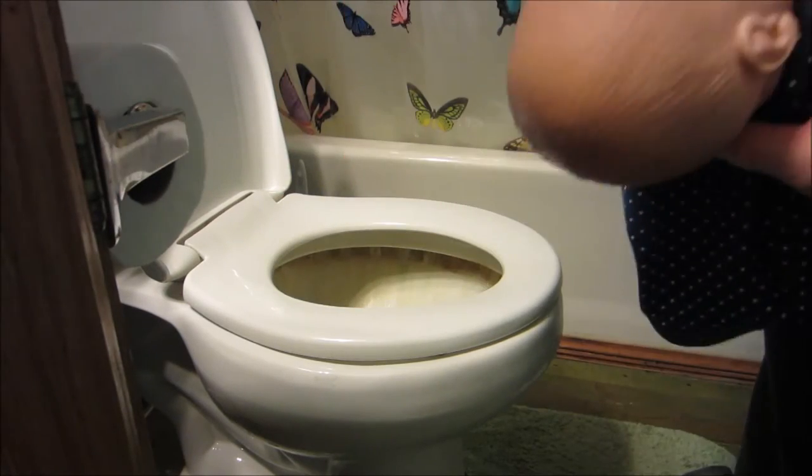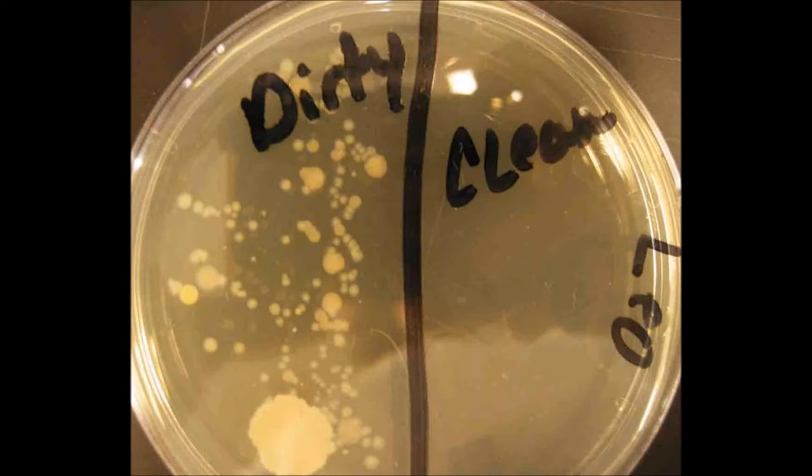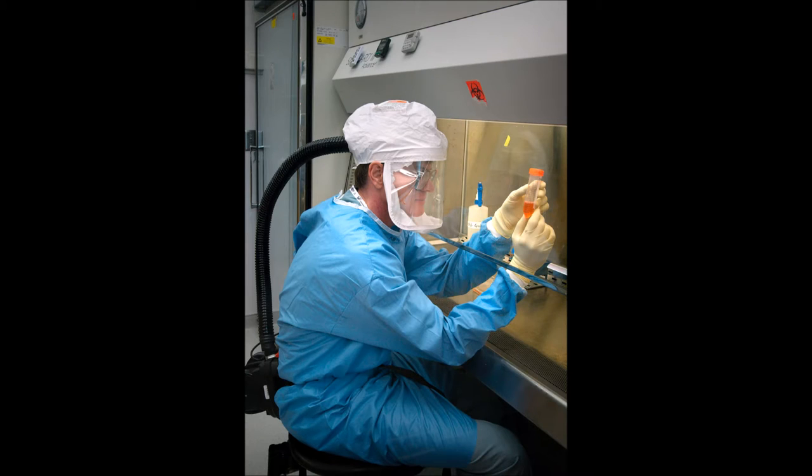A few things I wanted to mention before I reveal the results. The testing could have been better - I probably should have only swabbed and inoculated about half of my agar plates. Also, for all the safety police, I probably should have taken more precautions when handling cultures.